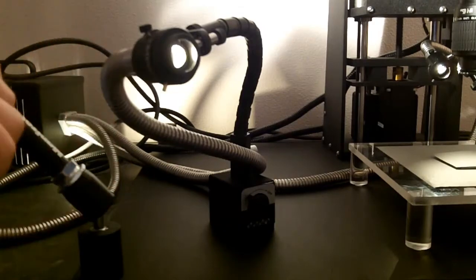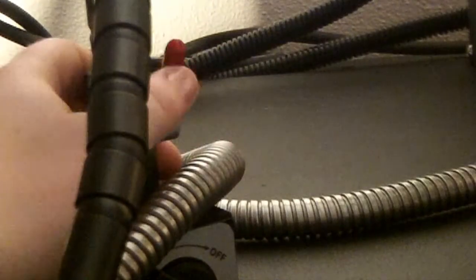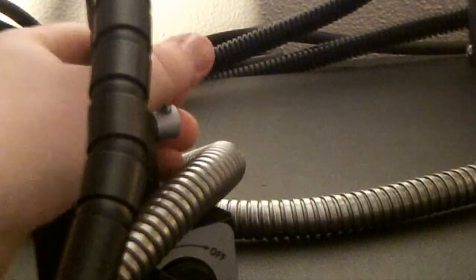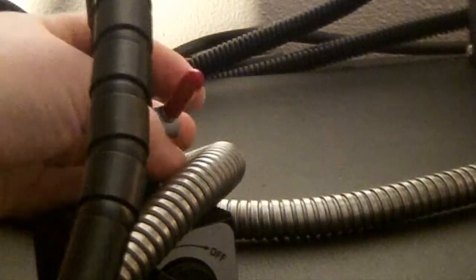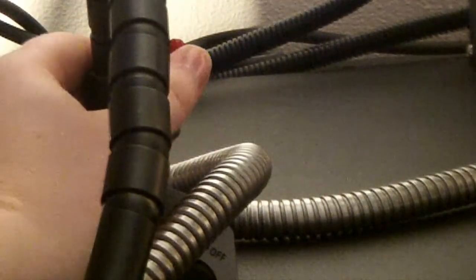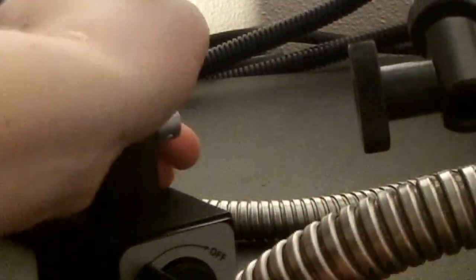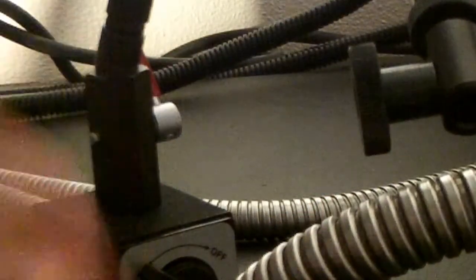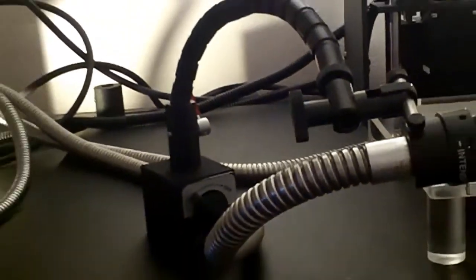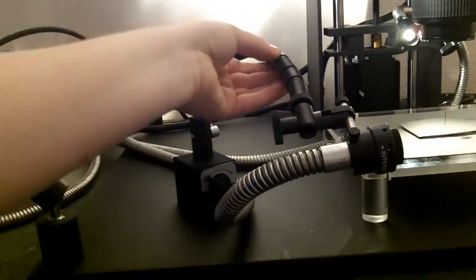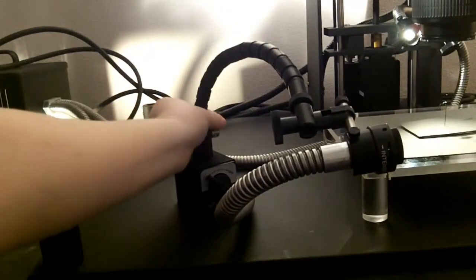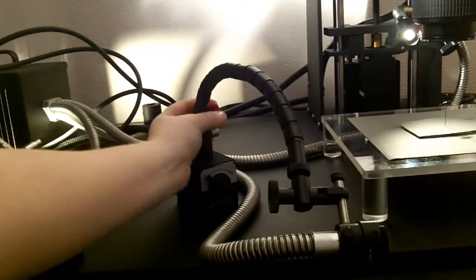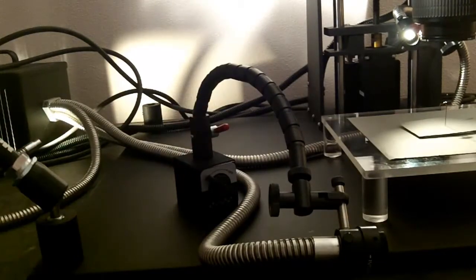Towards the bottom of the arm is a red locking lever. As you move it up you'll feel more resistance and it will hold the arm in place. You see here now it's quite sturdy and as I move the lever down it'll unlock the arm and you can move it around to position it.